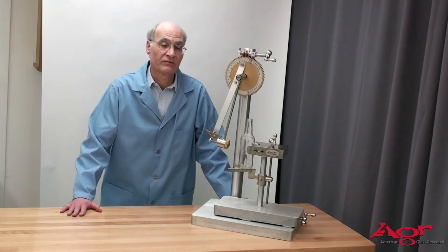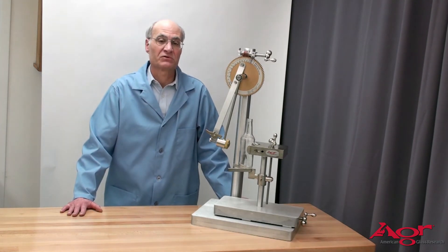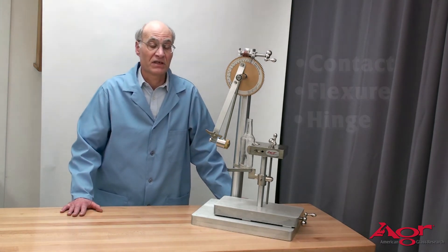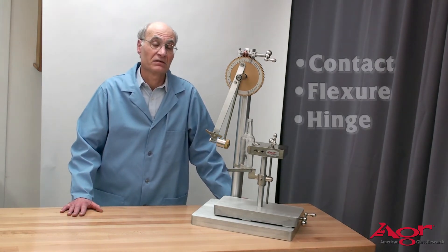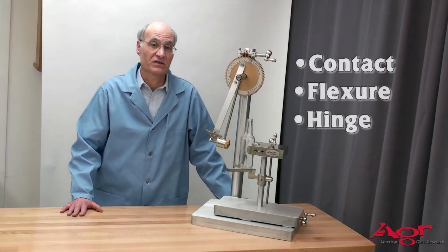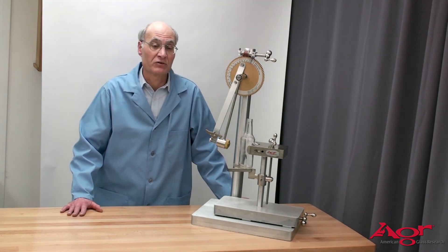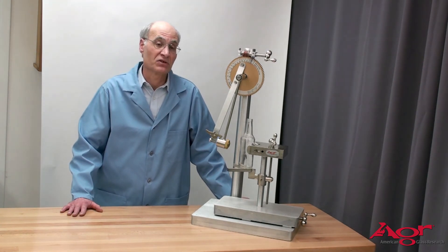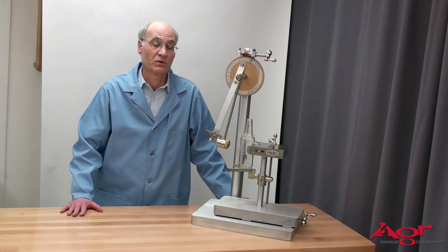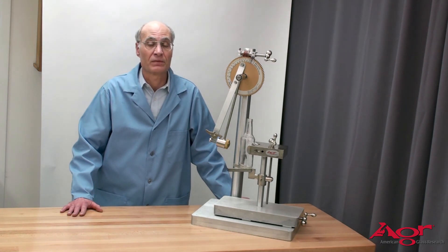In general, for any impact event, three different types of stresses are set up in the bottle. They're referred to as contact stresses, flexure stresses, and hinge stresses. The distribution of the stresses and the magnitude of them depends on the impact point on the bottle, as well as other circumstances about the bottle shape and so forth.